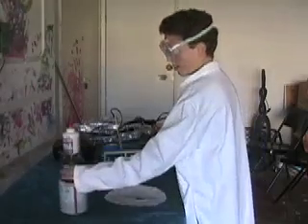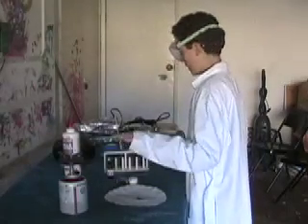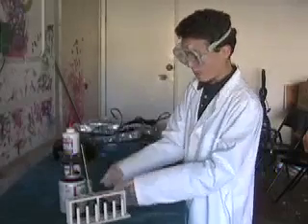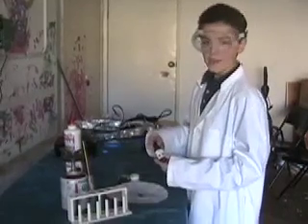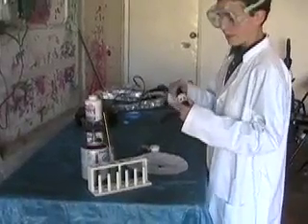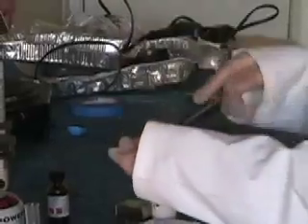I've got a camping stove here, which will give me a nice flame. I've got boron here, and I've also got a test tube full of very pure hydrochloric acid. This is much purer than the hydrochloric acid I used in my hydrogen, beryllium, and lithium videos — that stuff was from the hardware store and was very impure. This is really high-grade stuff. I've got this inoculating loop, this nichrome wire, and I had it in the hydrochloric acid.